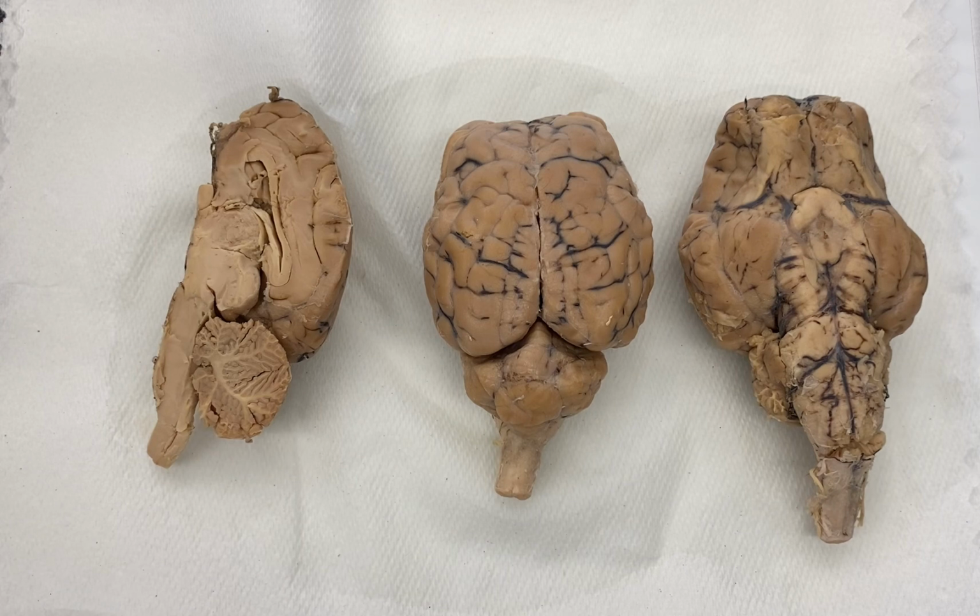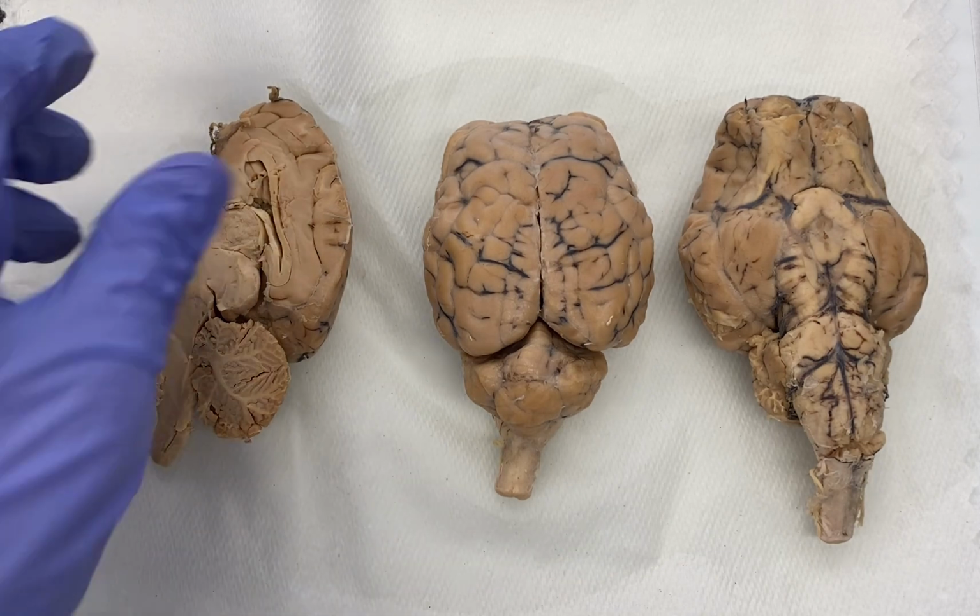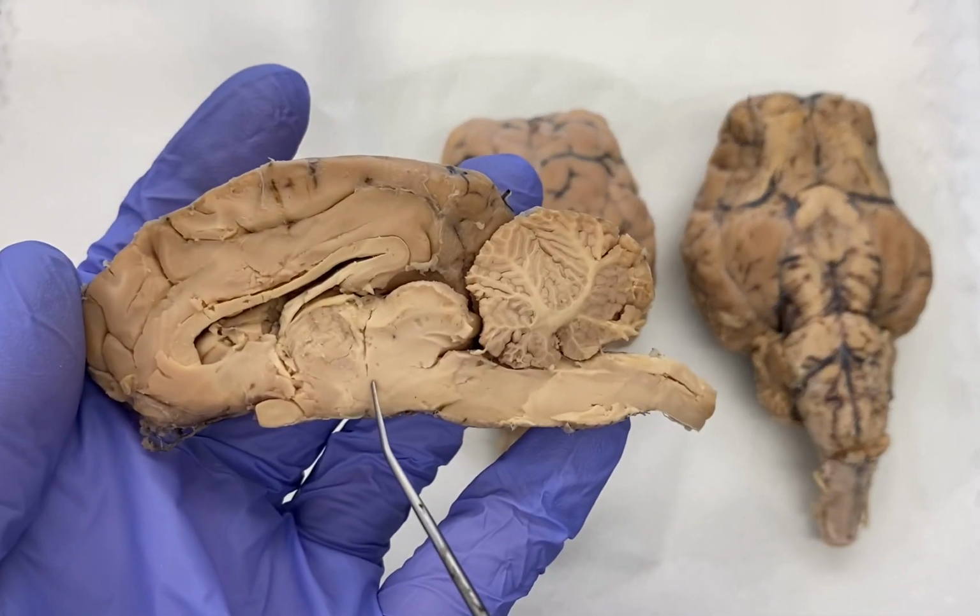The hypothalamus is largely involved with lots of autonomic functions. Control of visceral structures, so think internal organs. It also controls things like hunger, thirst, and appetite. Our internal body temperature is regulated by the hypothalamus. And it's also an important endocrine structure as well. It produces and releases various hormones that will influence other structures, maybe like the pituitary gland, and then other more distant areas in the body. So again, that is our hypothalamus, this approximate region here.